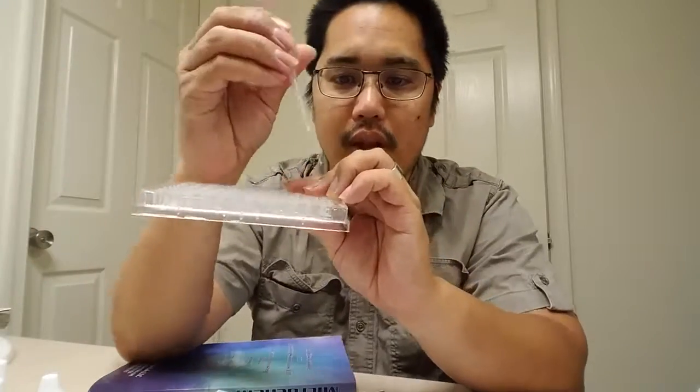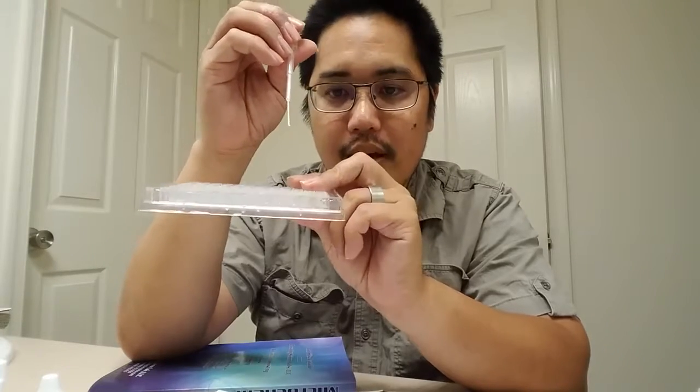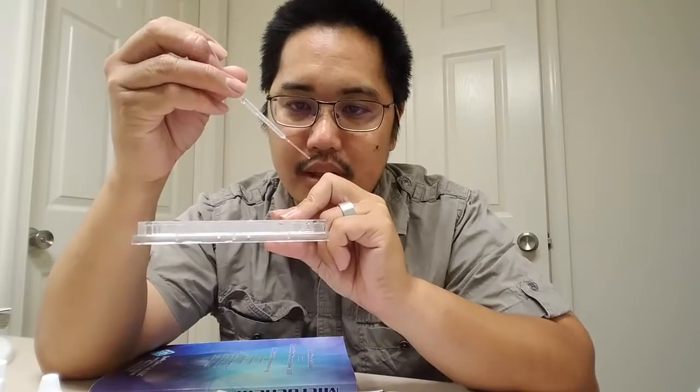All right, the next thing you're going to do is, we know that the liquid in well A1 is 0.1 molar calcium nitrate. Wells 2, 3, 4, 5, 6, and 7 have pure water in them, so there's nothing else in there. So I'm going to suck up some liquid into here. Okay, you see the liquid in there? All right. Now I'm going to put 2 of these drops.